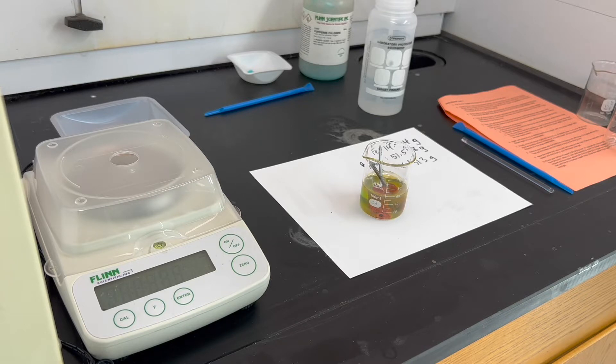Today's procedure is all about collecting that copper and measuring its mass. We want to collect it, clean it, and see how that mass compares to what our stoichiometric calculations show. We can also make a prediction about how much iron should be left in the nails, and that's a secondary objective of this day's procedure.